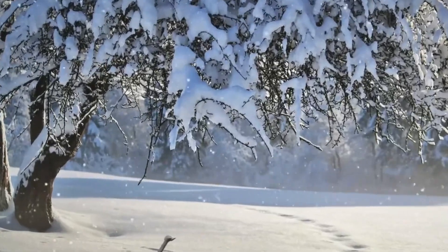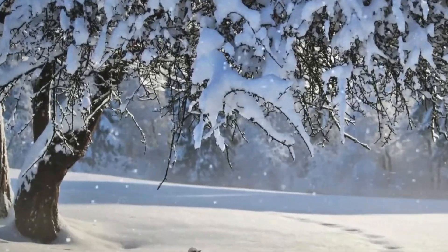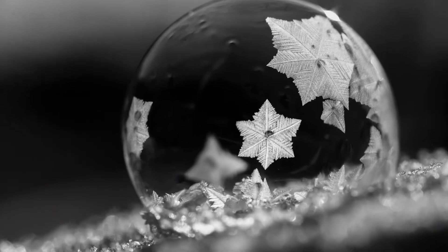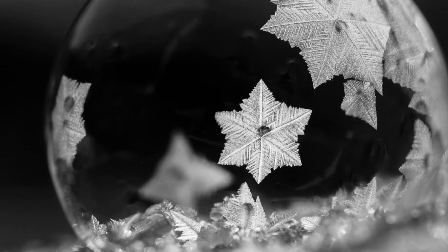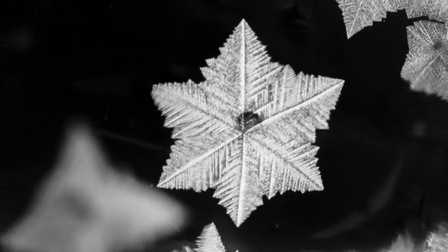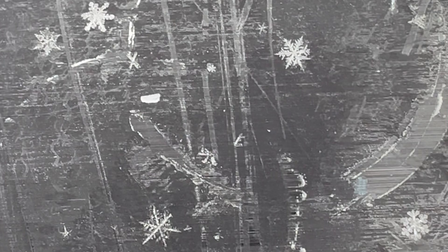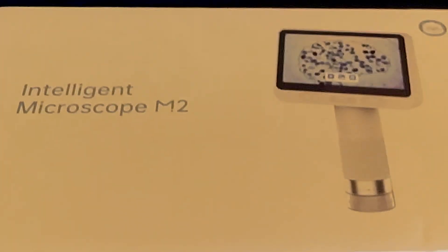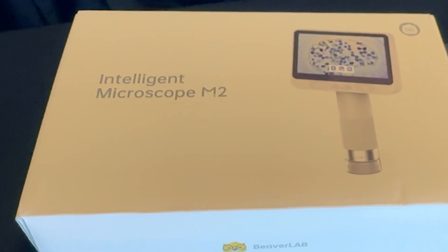I think snow is absolutely beautiful, so an experiment I've always wanted to do is view the six-sided symmetry of a single snowflake up close. I've been able to do this fairly well just using the zoom feature on my cell phone camera, but I wanted to see things just a bit more closely. So I was really excited to try looking at a snowflake with Beaver Labs Darwin Digital Microscope.